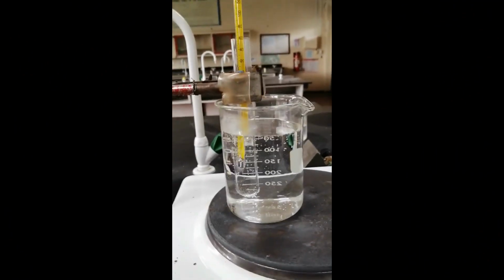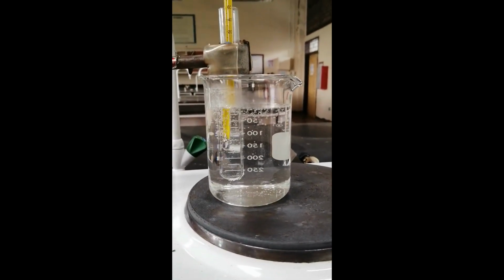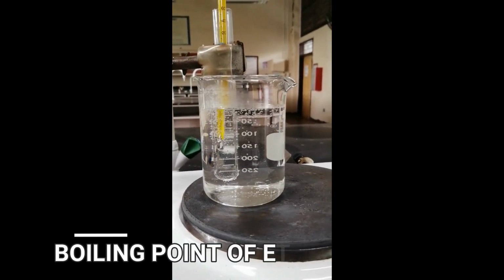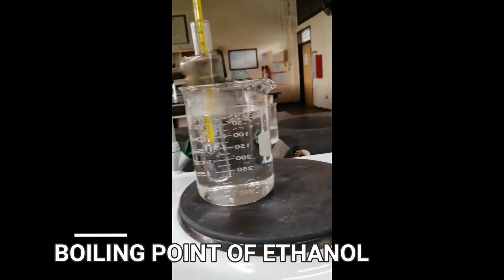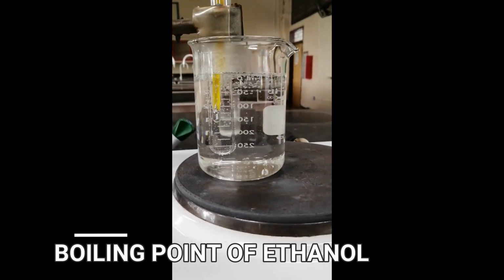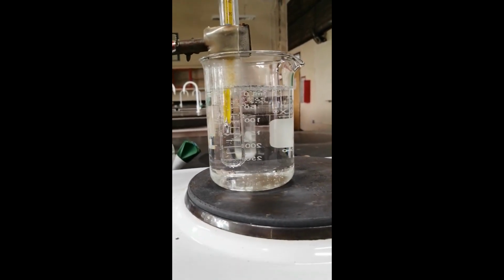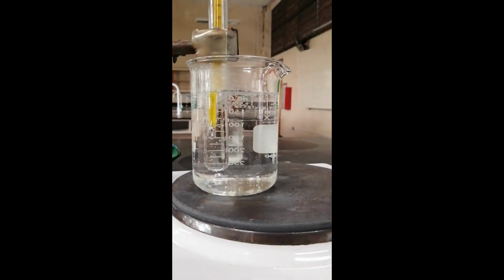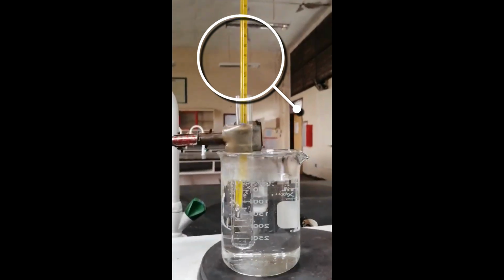So for the next substance or compound, this is ethanol. So the setup is make sure na-submerge yung test tube with all the liquid in the water bath. So nagbo-boil na yung test tube. Let's see kung anong temperature.